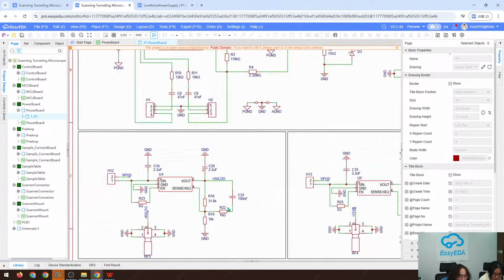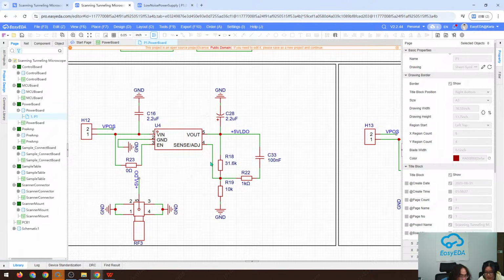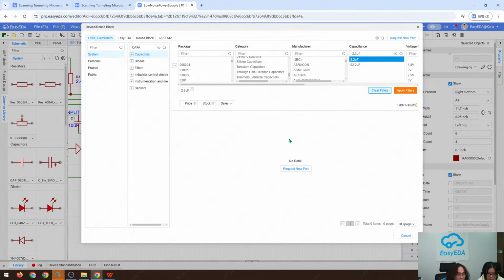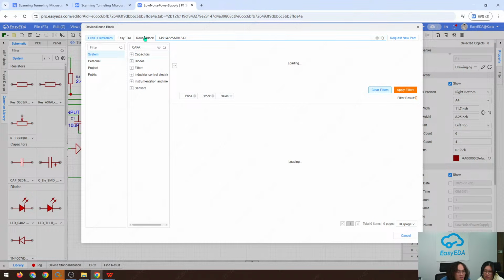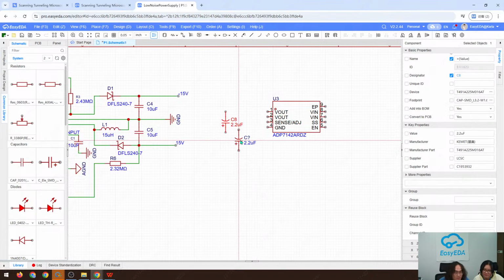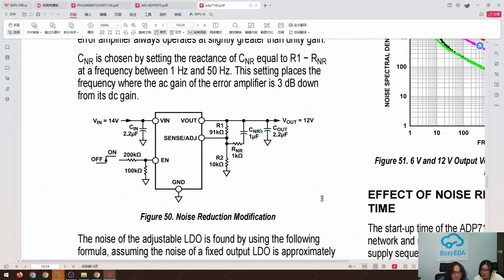Maybe we can just use this manufacturer. Okay, we can use this one, yeah, this type of capacitor. And 1 microfarad.